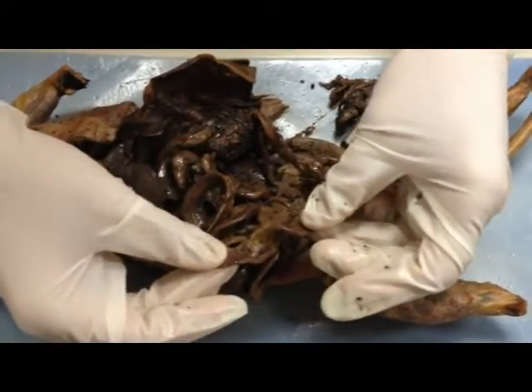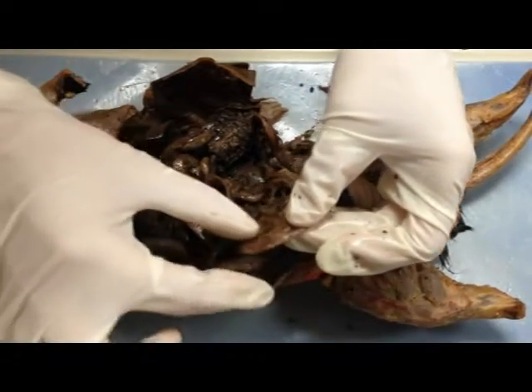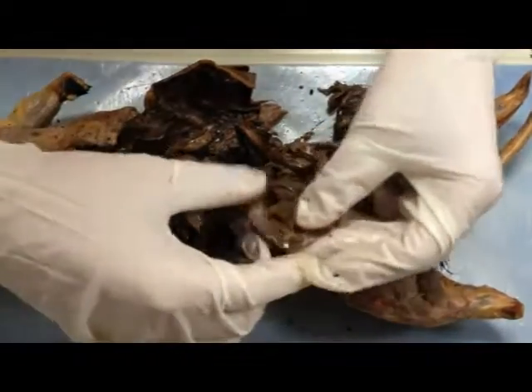Some of them — this guy has a pretty small large intestine — but sometimes there's a big difference between the large intestines and the small intestines.